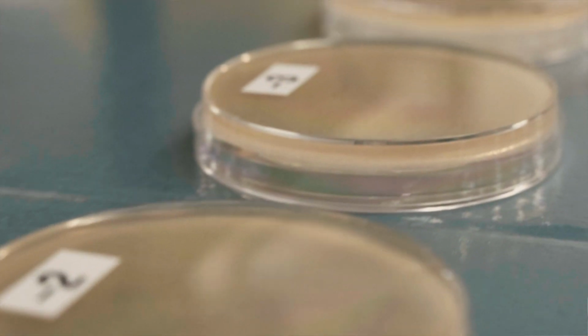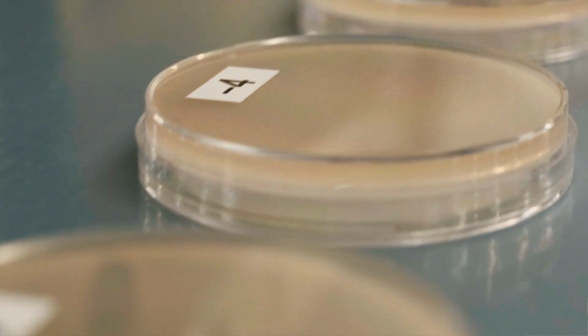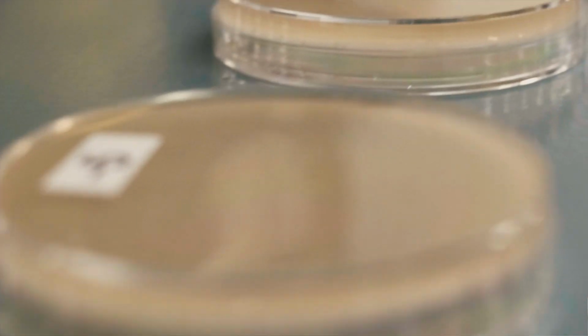Bacteria are host to a special group of viruses called bacteriophage or phage. Phage go through multiple rounds of infectious life cycles with bacterial cells. In this experiment, we will study the virulent phage T2 by using techniques to observe phage activity indirectly through their impact on bacterial host cells.